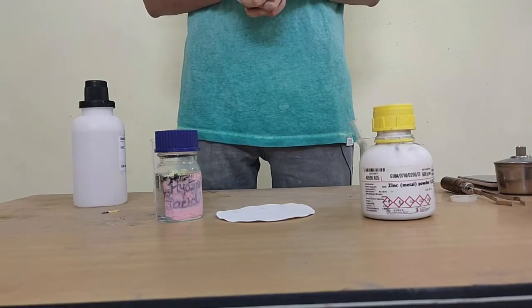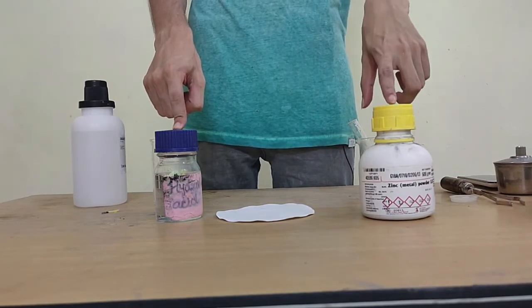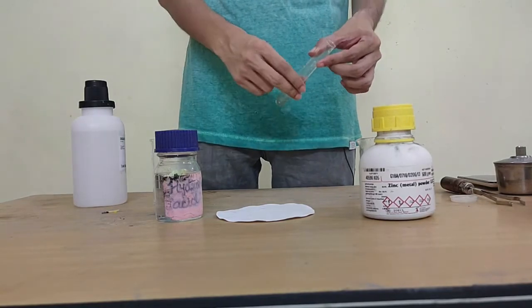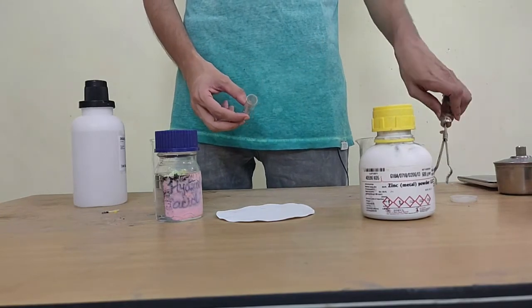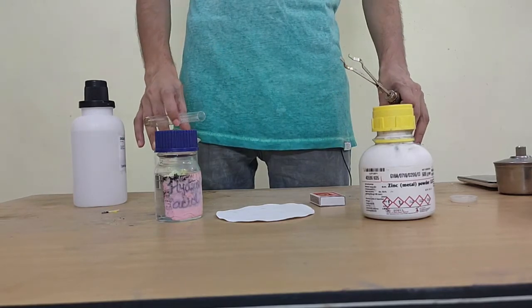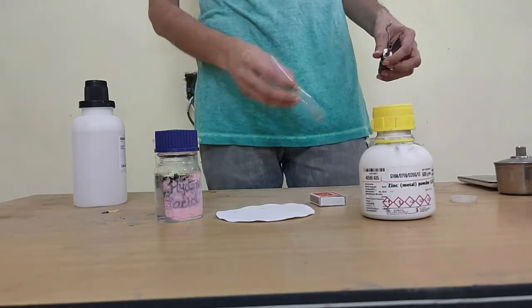Now for our apparatus, I'm going to need an acid, in this case hydrochloric acid, and zinc, metal of any form. We're going to need a test tube for the reaction. We're going to need a test tube holder to hold the test tube. We are going to also need a matchbox and any other supportive equipment. In this case I might need beakers, which are not entirely necessary, but I might need them. Okay.